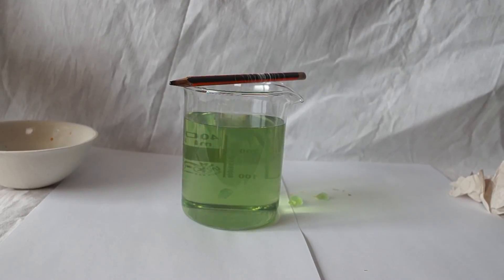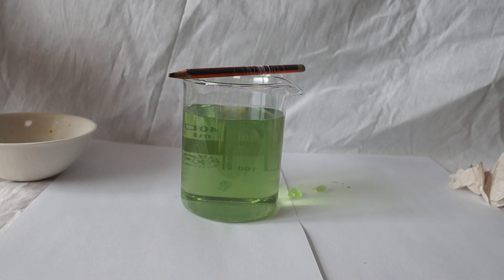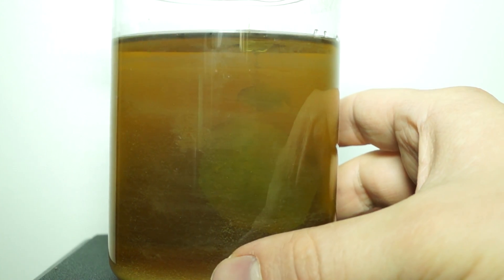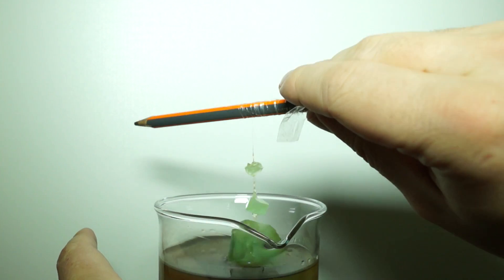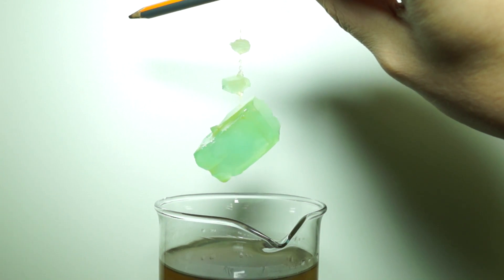Now we shall put the glass of growing crystal in the closet to protect it from dust. Over time, the water will evaporate from the solution and the excess salt will form a large single crystal from the seed.